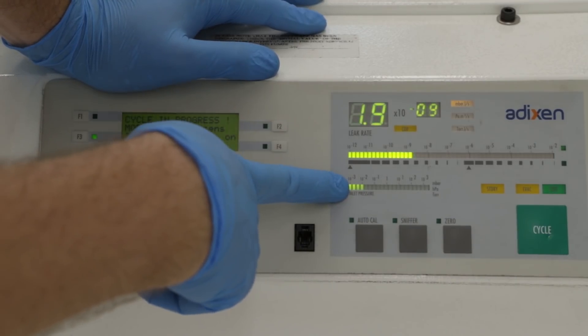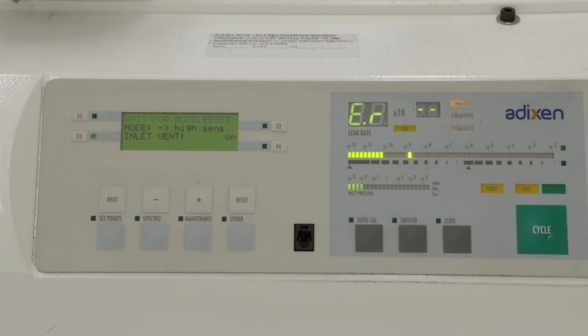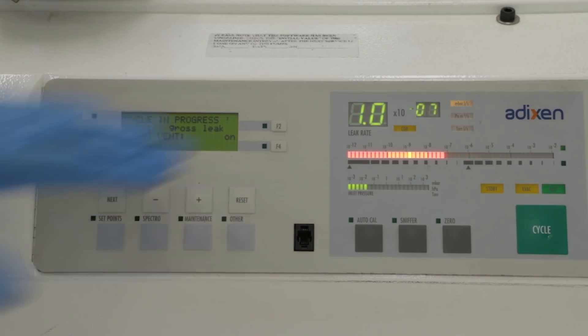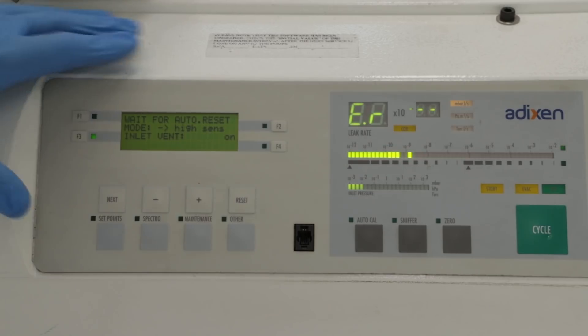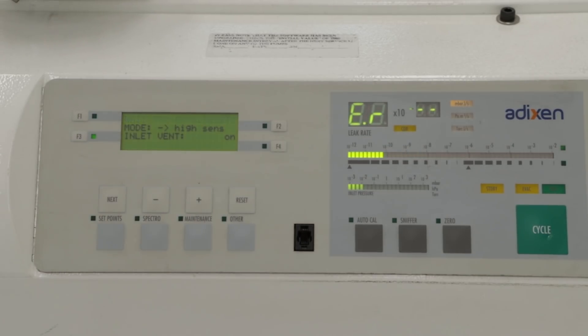Looks like we still have some leak in the system. Again, of course we have the leak on the turbo pump, but in this case it looks like we also have a large leak which is preventing us from reaching a vacuum where we can actually do the leak test.